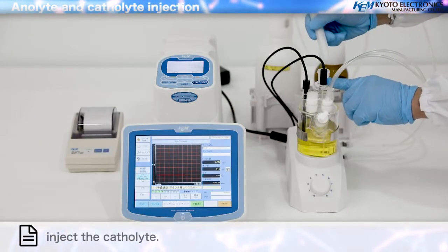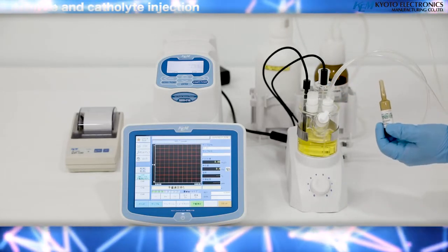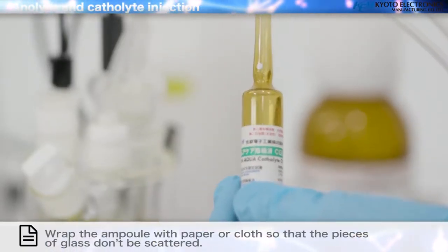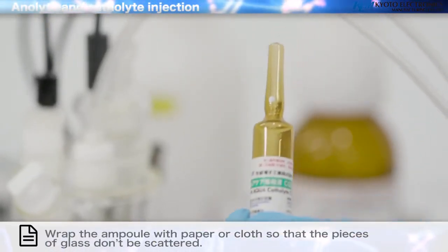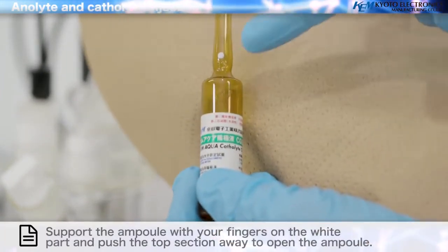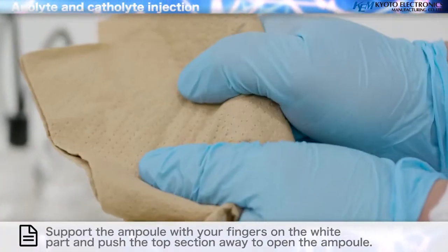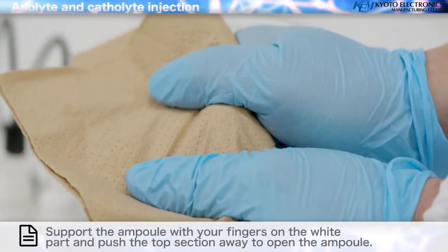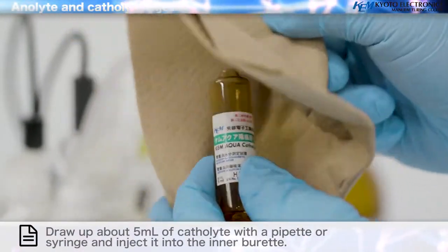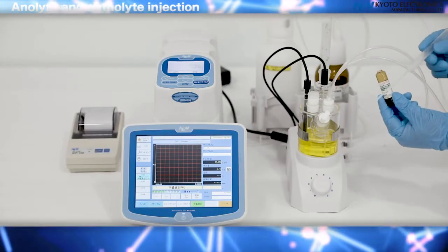Next, inject the catholyte. Prepare a glass ampule containing catholyte. Wrap the ampule with paper or cloth so that the pieces of glass don't scatter. Support the ampule with your fingers on the white part and push the top section away to open the ampule. Draw up about 5 milliliters of catholyte with a pipette or syringe and inject it into the inner burette.